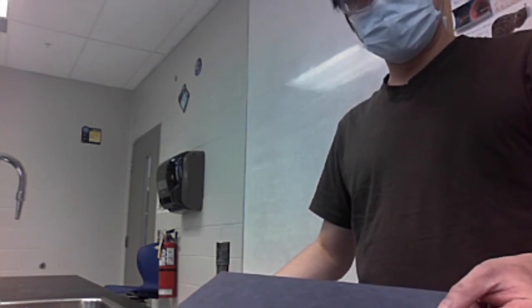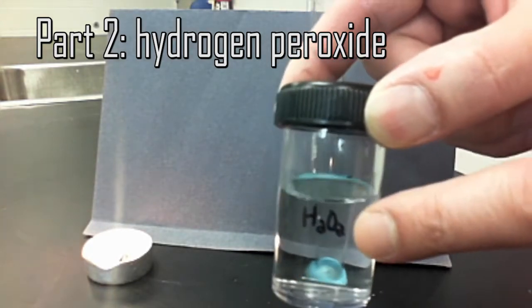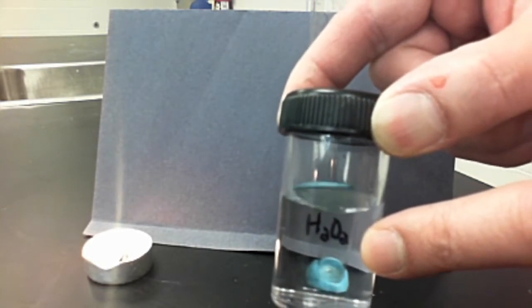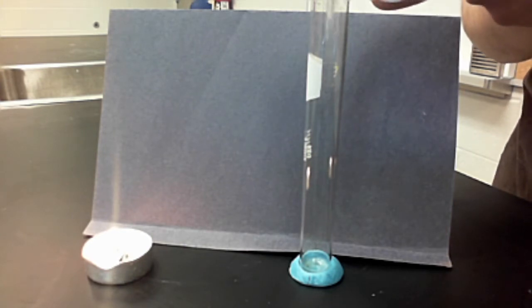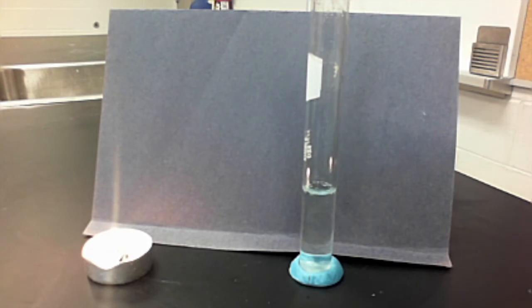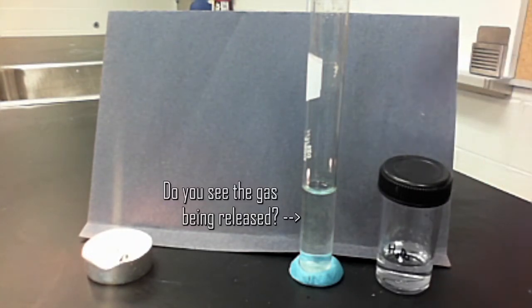What I have here is some hydrogen peroxide. 'Peroxide' means more oxygen than what naturally exists in nature. The formula for hydrogen peroxide is H₂O₂. I'm going to pour some of this H₂O₂ inside this test tube. Hydrogen peroxide naturally wants to break apart — think about the proper chemical term for a substance that likes to break apart.